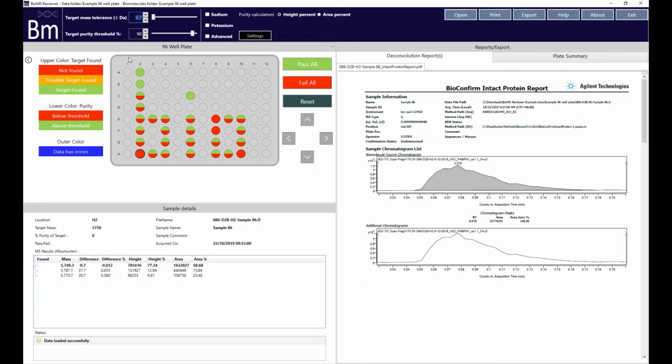BioMS Reviewer adds up the response of all of the peaks in the MS data and calculates what percentage of this response is attributable to the target molecule. A user-defined threshold for this purity calculation, set using the threshold slider in the menu bar, determines whether the lower half of the circle is green, showing that the calculated purity was greater than the threshold, otherwise it is shown as red.